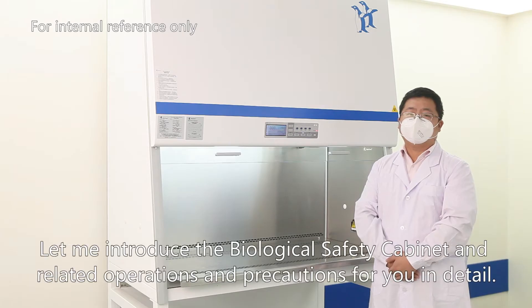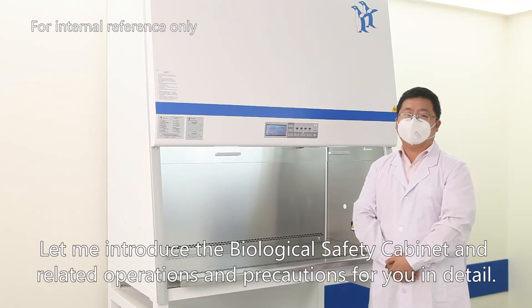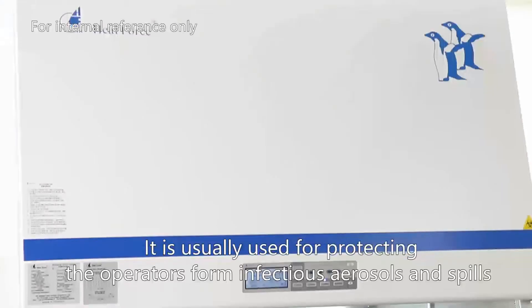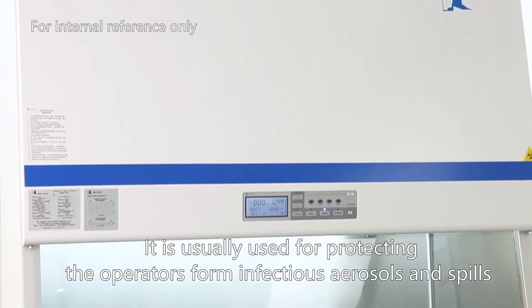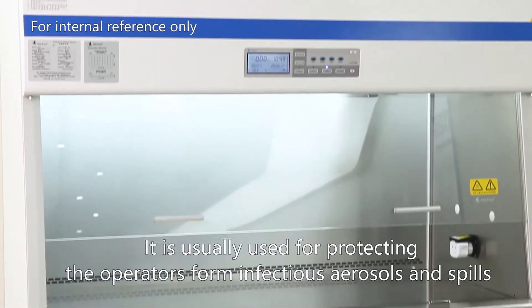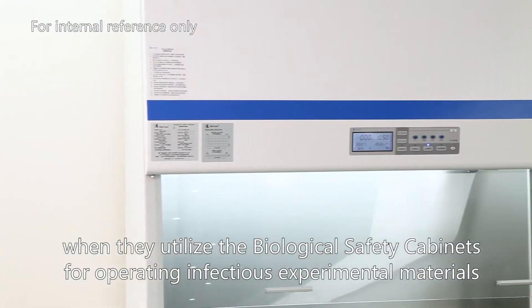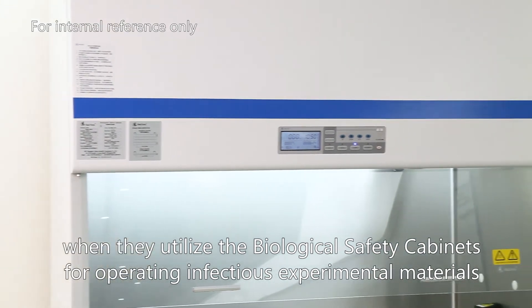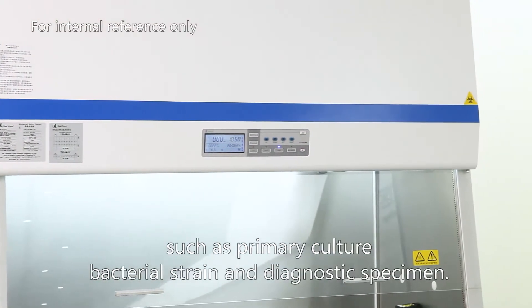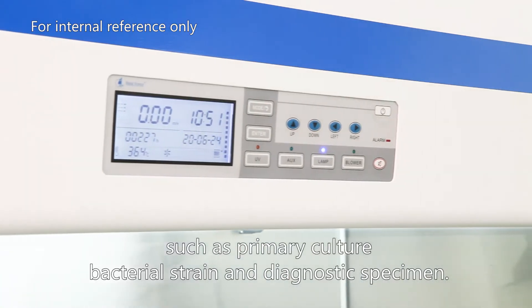Hello everyone. Let me introduce the biosafety cabinet and the related operations and precautions for you in detail. It is usually used for protecting operators from infectious aerosols and spills when they utilize the biosafety cabinets for operating infectious experiment materials such as primary culture, bacterial strains, and diagnostic specimens.